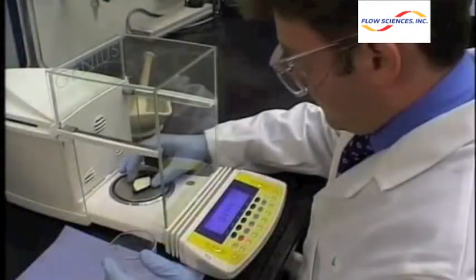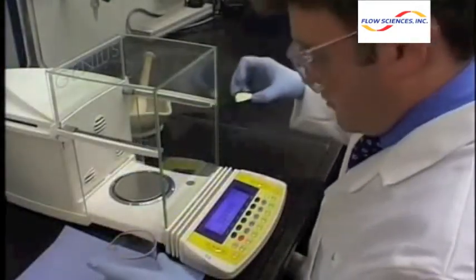The lab technician is in close proximity to the potent powders during routine handling, creating exposure levels. To ensure best lab practices related to personnel protection, it is important to handle potent compounds and active pharmaceutical ingredients inside of a contained environment.